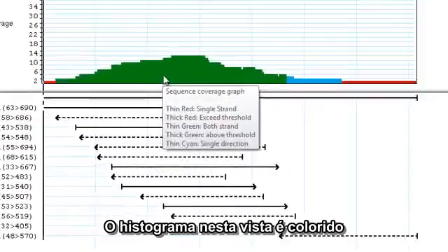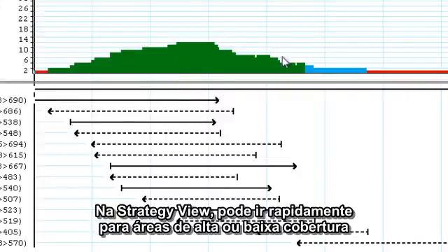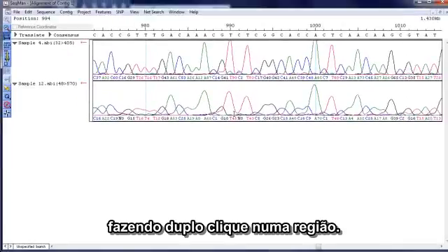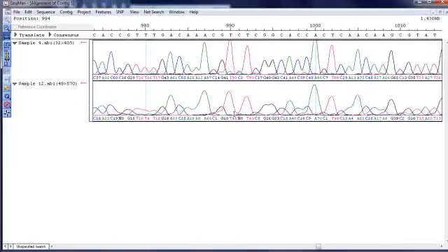Use the strategy view to see a graphical representation of coverage along the assembly. The histogram in this view is color-coded based on depth of assembly and sequence directionality. From the strategy view, you can quickly jump to areas of high or low coverage by double-clicking on a region. You may wish to do more sequencing in areas of low coverage.